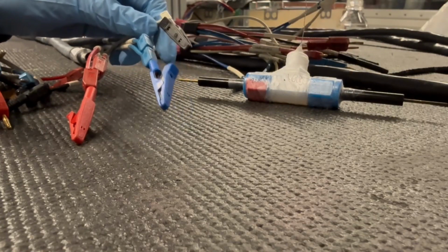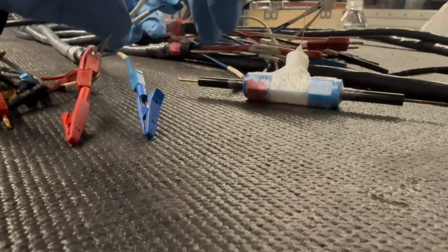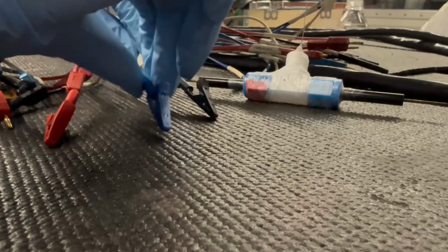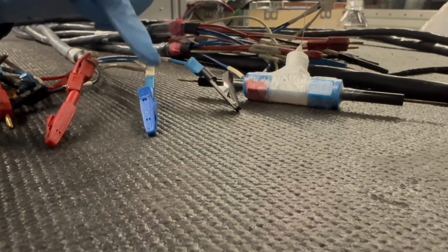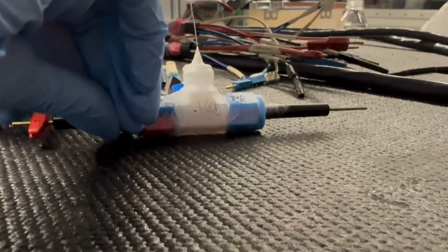So, first of all, swap the S2 and S3 wire, that is the white wire from the reference electrode and the light blue wire from the counter electrode. Now we can connect the red wire to the working electrode, S3 as the reference electrode, and the other one to the counter electrode.